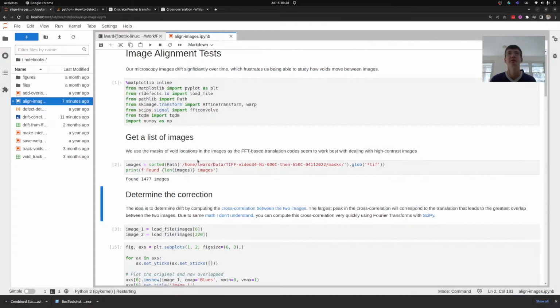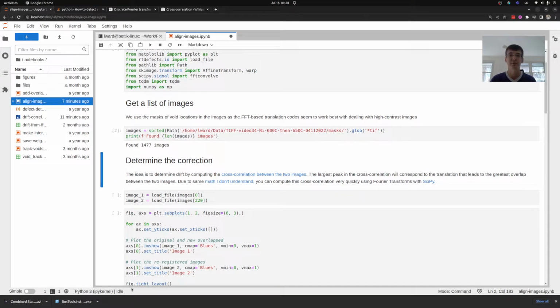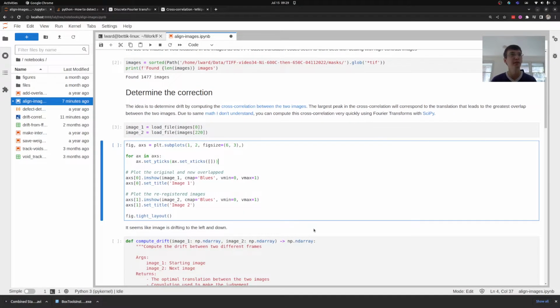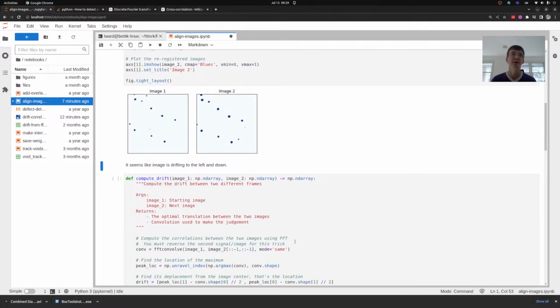Let's restart and clear all outputs. So I'm going to load in a series of images. These are images that I've taken, and as in our video, I've computed the mask of where all those voids are located. Correlation is going to work best when we have images with less noise in them, and I'm removing all noise, that is everything except the drift in the voids that I care about. So let's pull two up. I'm pulling them far apart in the video to exacerbate the differences between them. And you can see between this first and second image, I can look at the patterns of these voids and note two things. It tends to drift to the left. See these two? They've moved to the left, and they've also moved down a little bit. So that's what I'm expecting to find.